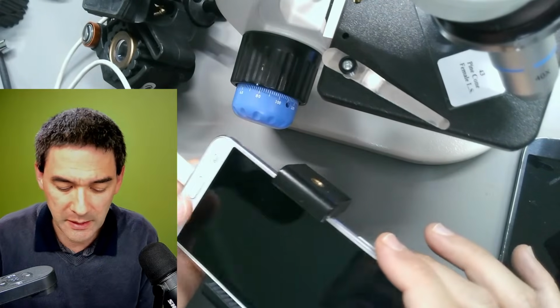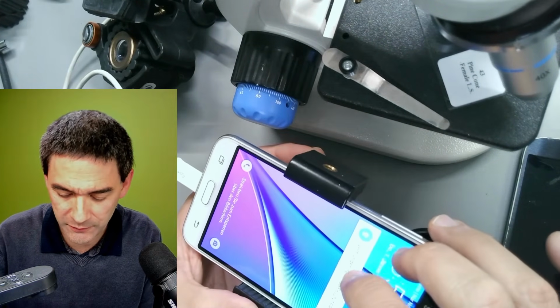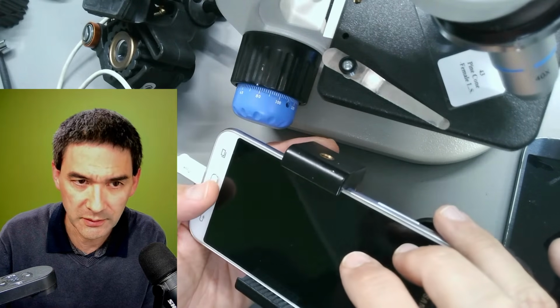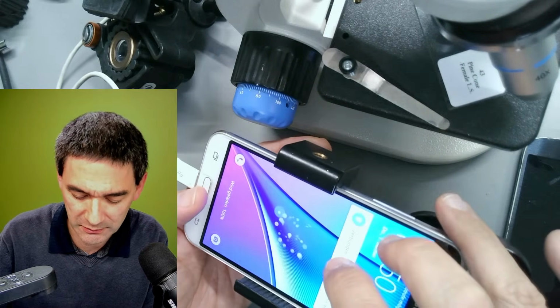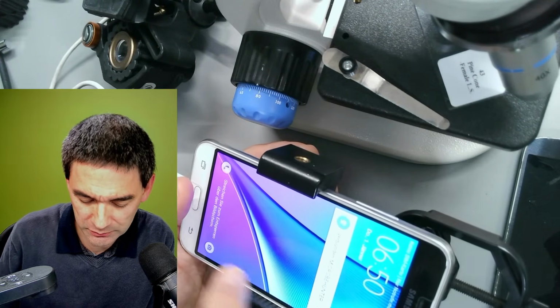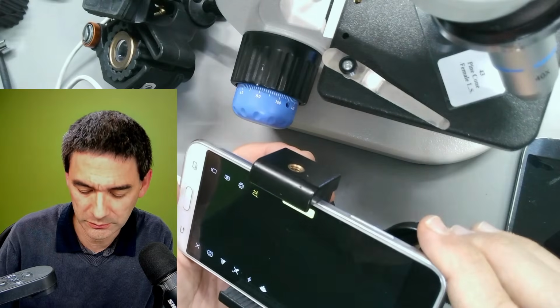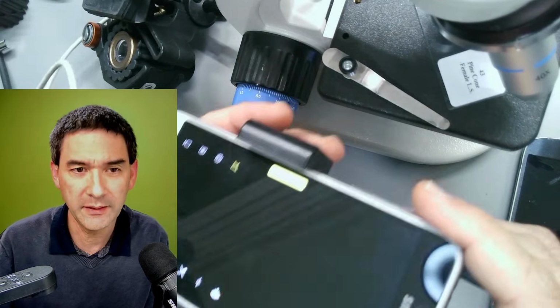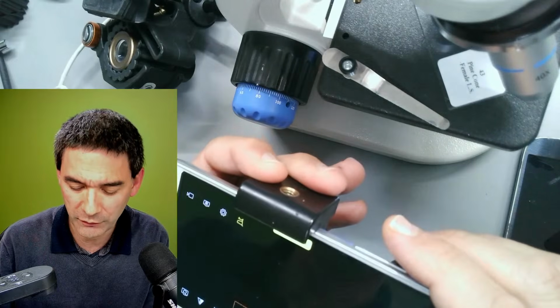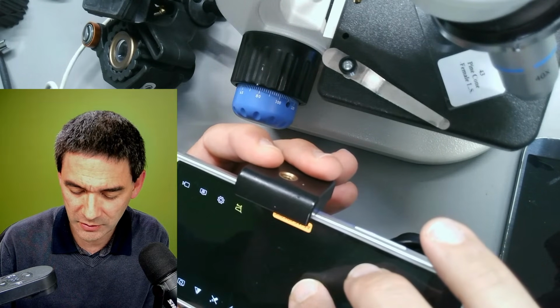Just also wanted to show you over here. If you click on here, then you should be able to see the image. Okay, here we go. I shifted the camera a little bit, unfortunately, so for this reason I'm just going to show this to you.